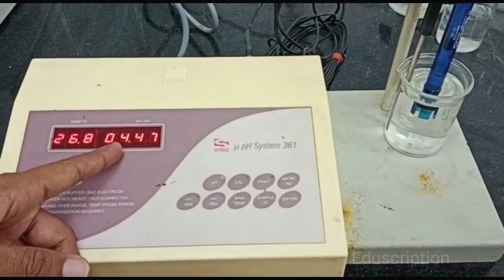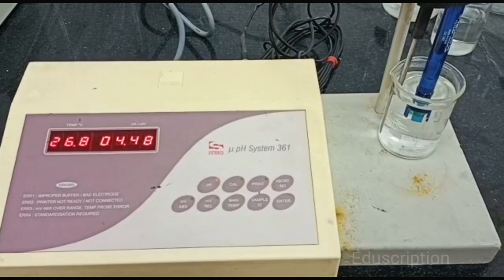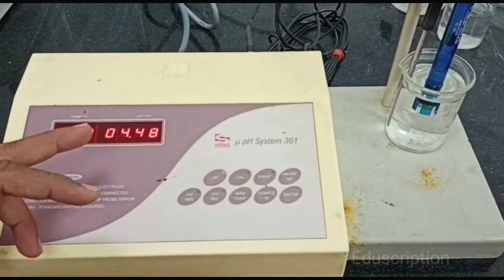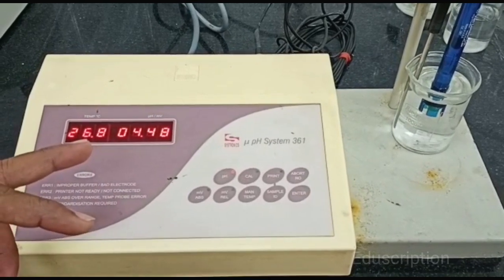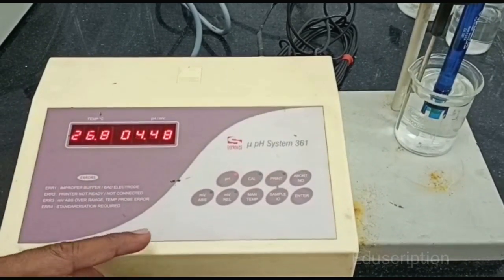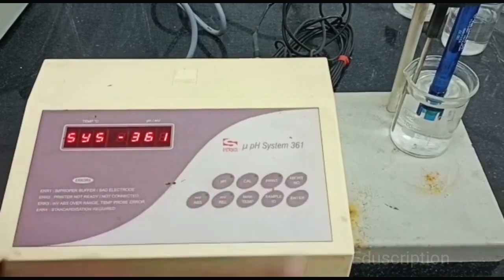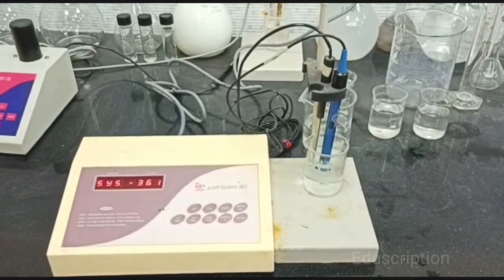No need to note out the temperature, only note out the pH value of that beaker. See, second beaker, the pH value is 4.48.